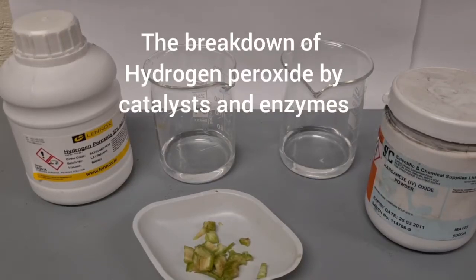In this video we're looking at the decomposition or the breakdown of hydrogen peroxide using a catalyst and using an enzyme.